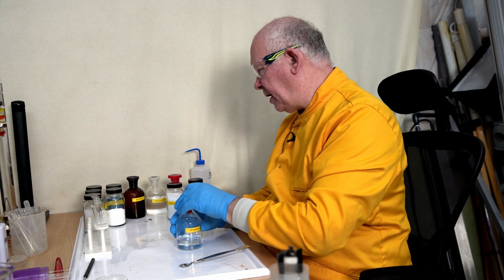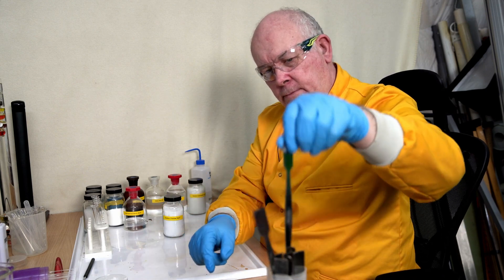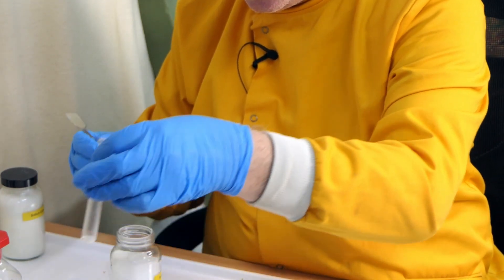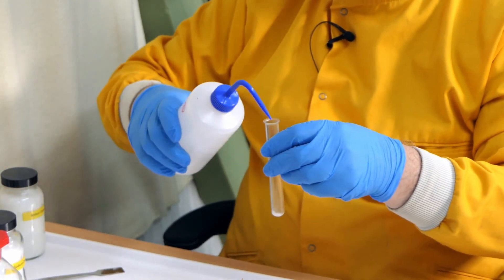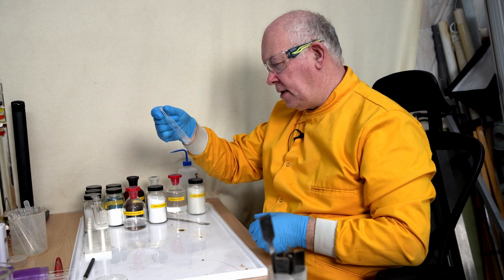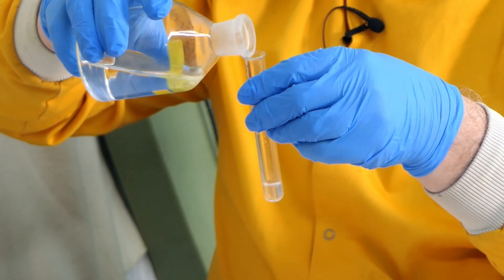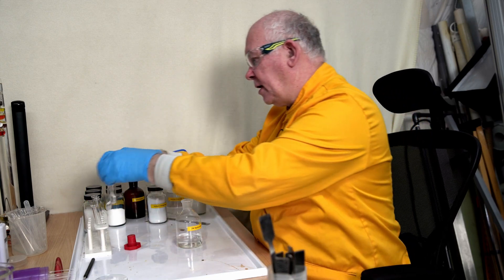Let's take a look at what a negative test would look like. I've got some sodium chloride here, and if we take some sodium chloride and add some distilled water — we only need about a one centimetre depth — it's dissolved. And then let's add some hydrochloric acid to it. So we've got a positive test with bubbles, a negative test — nothing happened.